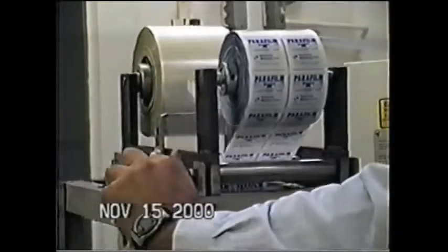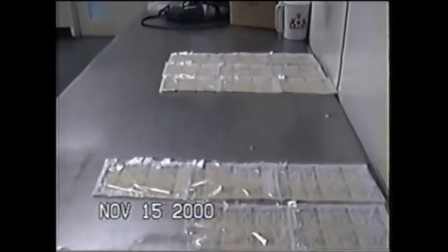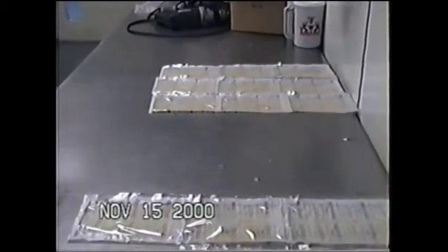Here is a packet system filled with gel, and this will be used to demonstrate oviposition. The packets are being made at the USDA GAST facility.